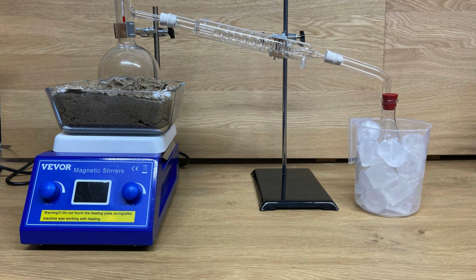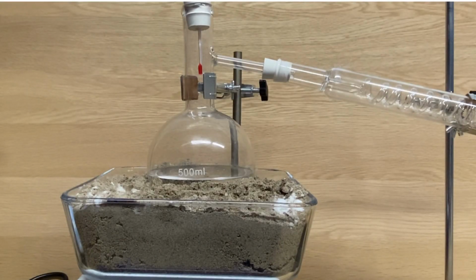In this case, I bought a simple distillation apparatus at Amazon for about 80 euros. It is good for the exercise, but as you can see, the connections are basically stoppers made of rubber. For the future, I may invest in an apparatus that is connected with glass, since the rubber stoppers are not fully isolating. The alcohol, when it starts to evaporate, basically went through it a little bit on the side, and gas is basically poured out. This caused some of the alcohol vapor to get out, which means that I was not able to catch it and later liquefy it. And this resulted in less pure alcohol than I may have wanted, and loss of alcohol.